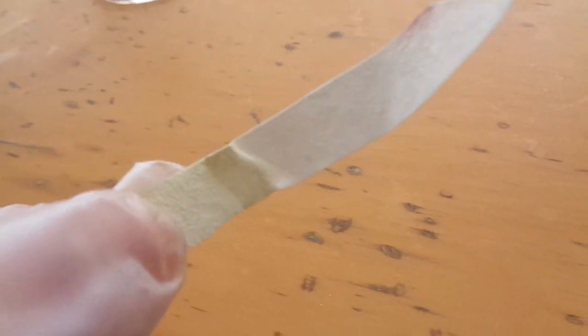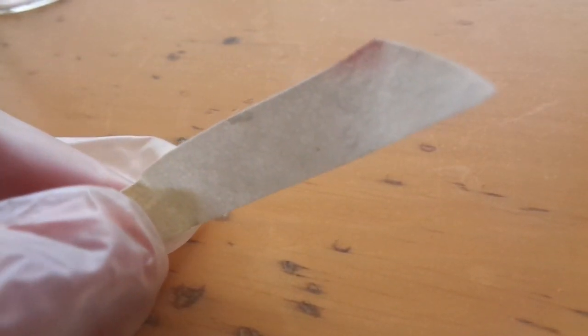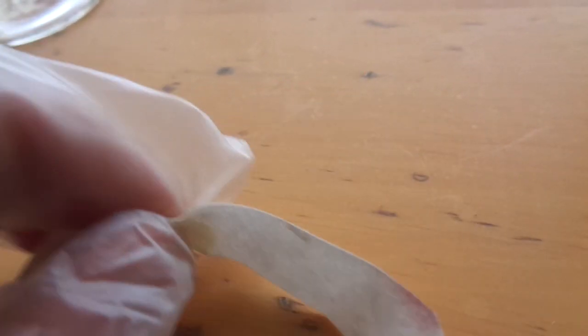Today I will show you something interesting that I recently discovered. So I got this paper and it's infused with sodium iodide and this paper can detect acidic fumes. So I'm going to show you that.